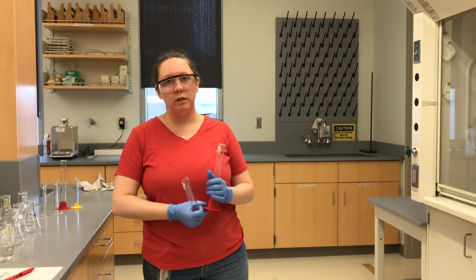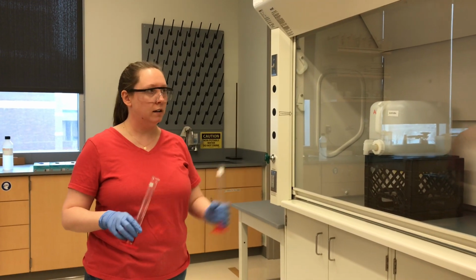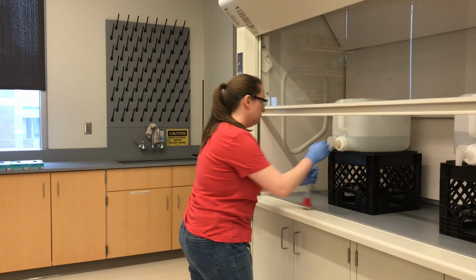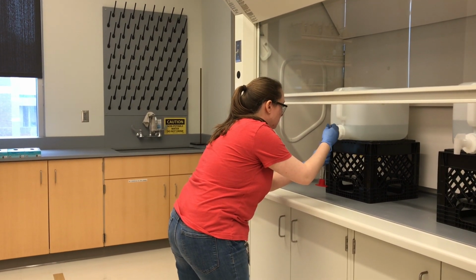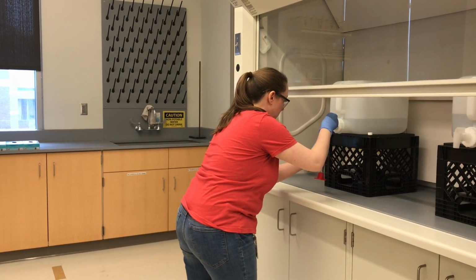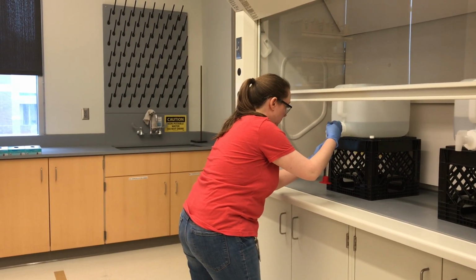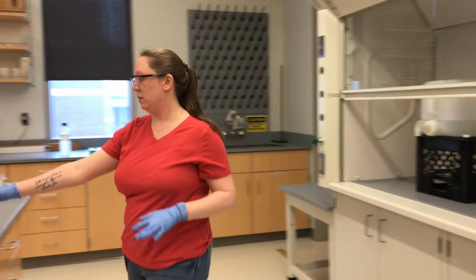So what we need to do is take 50 mils of HA, it's over here in A, and 50 mils of NaA. So I'm going to do that right now.